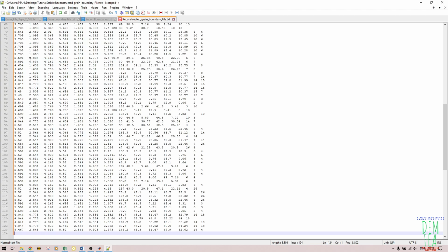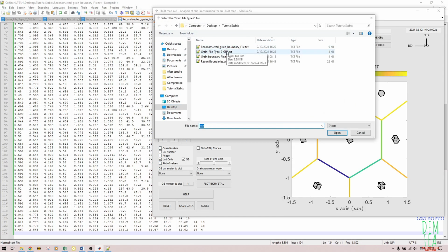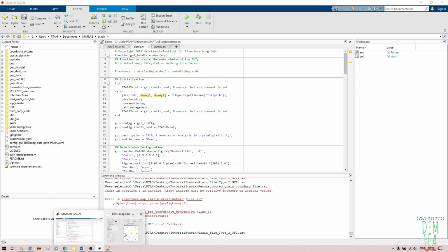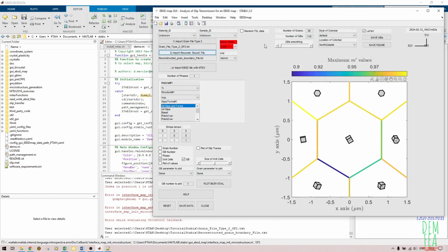Now once you paste like that, Control Save. As you can see, you don't need to worry about the arrangement. The software itself or the code will know which ones are columns. So, and then now we come here, we try to import again. So import grain file type, and then the next one. So that is what we have imported. And then the next one, we come and import reconstructed grain boundary file.